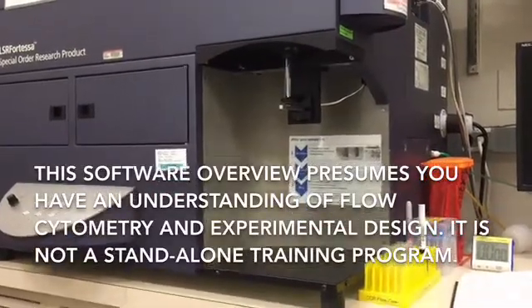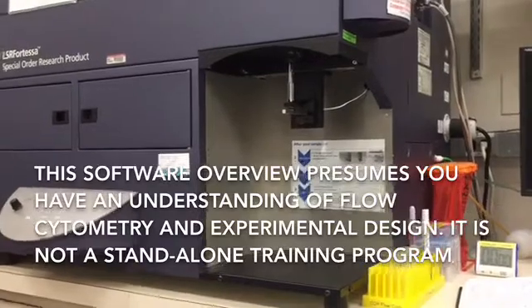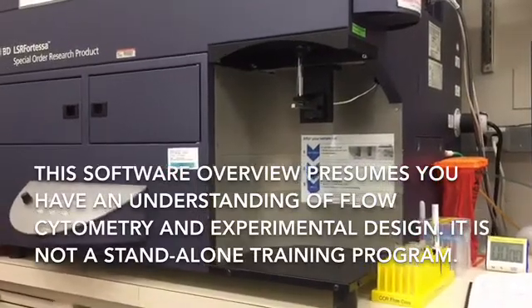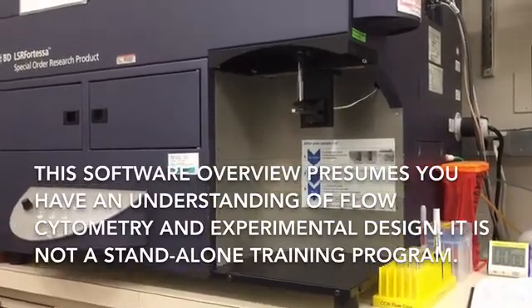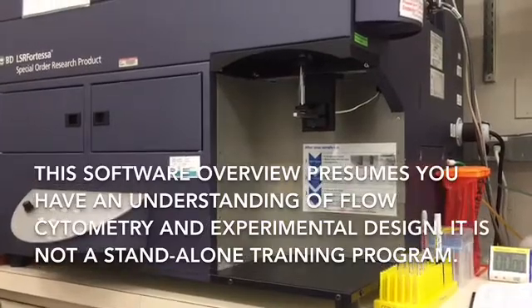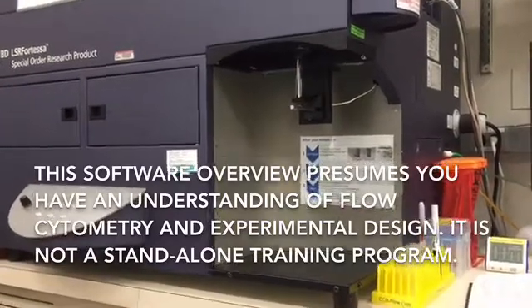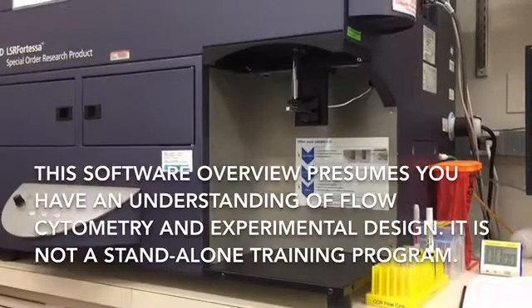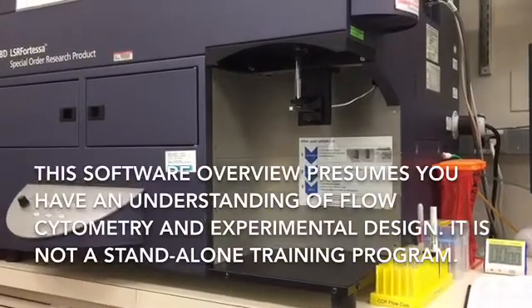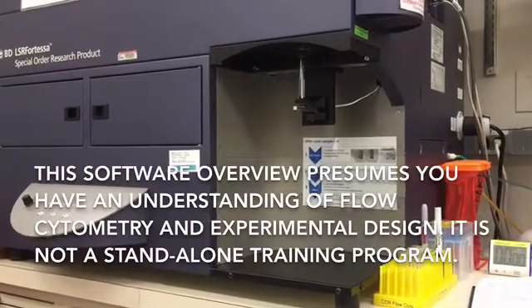Hi, this is Jeff Carroll from the CCR Frederick Flow Cytometry Core, and I'm going to give a quick visual overview of using the BD Biosciences analyzers. I'm at the Fortessa right now, but this overview will apply to any of the BD Biosciences analyzers that use Diva software.